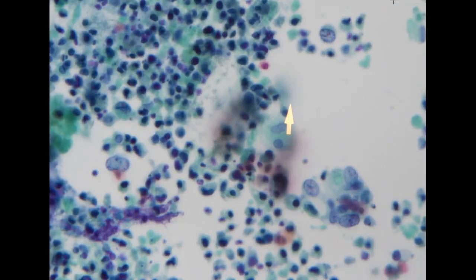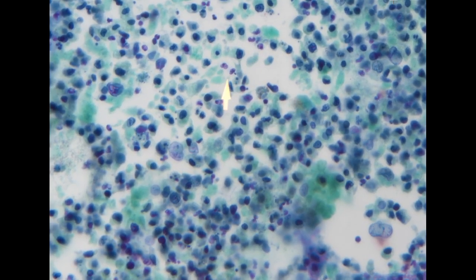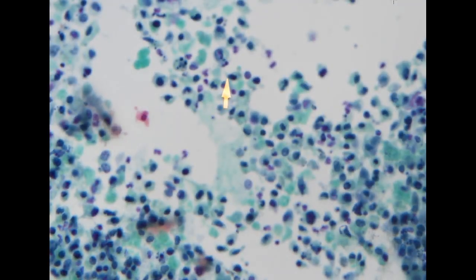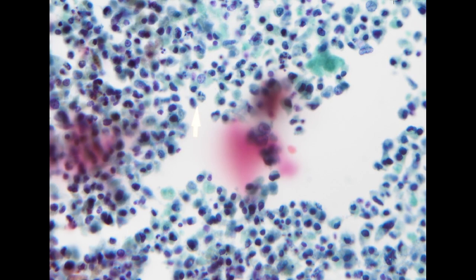So the first thing we know is that this is not a normal urine cytology, because in normal urine cytology you won't see this markedly necrotic pattern. So it's definitely unusual. The second thing is that we do see scattered keratinized cells, which suggests that the lesion may have focal squamous differentiation. Overall, the cellularity is high, but the majority of the cells are degenerated. However, we do see that the nuclei are mostly hyperchromatic.